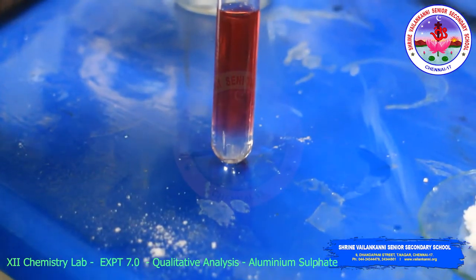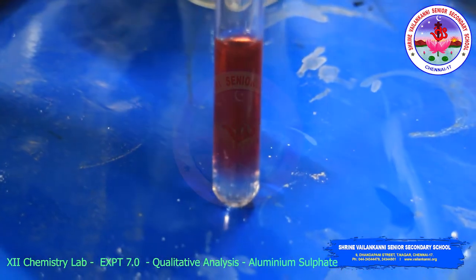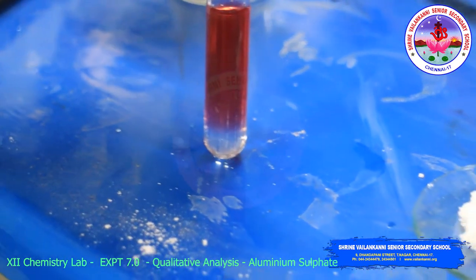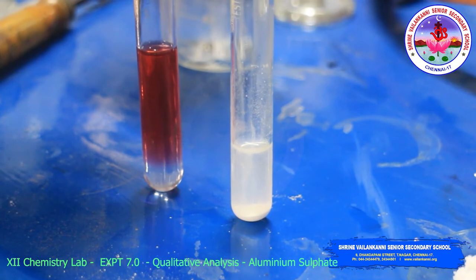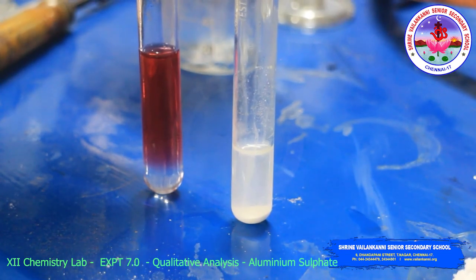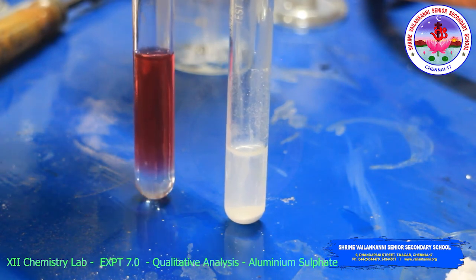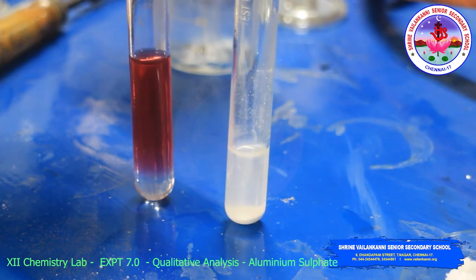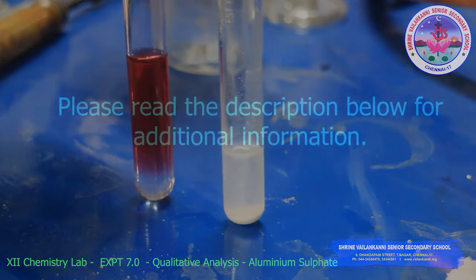So aluminum is confirmed. See the sulphate and aluminum: the red coloration is the lake test, a very important test, and the sulphate gives a white precipitate. The next salt test we will do.